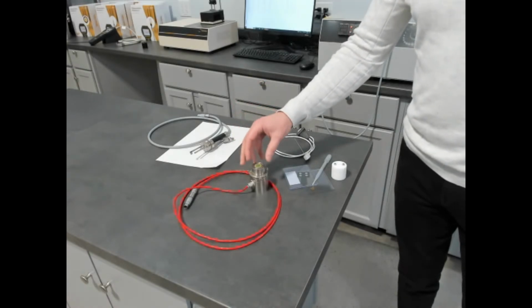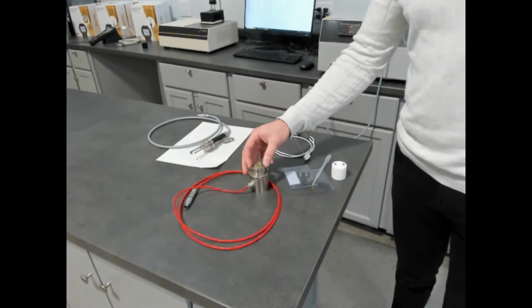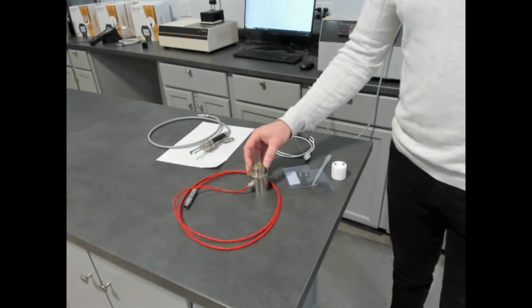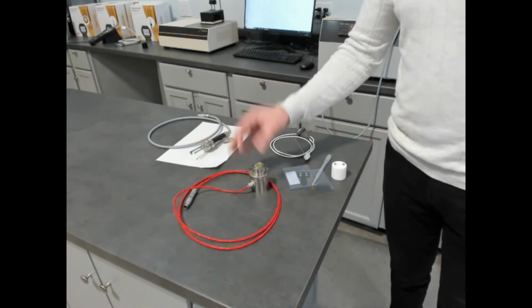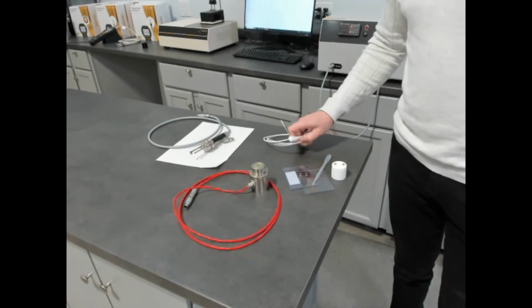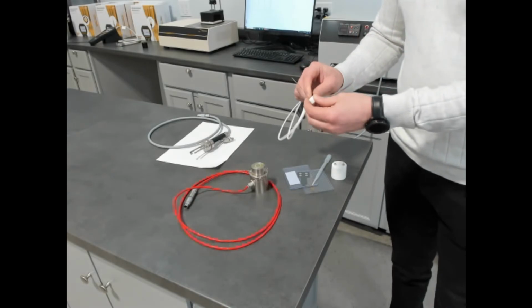It would suffer from the same effects of convection. Convection is effects of buoyancy. You can't correct for that. You can only limit it. Often for lower viscosity fluids, you have to input the volumetric specific heat of your fluids to test those as well. The other method that is, because it's a lower price, is the transient line source.